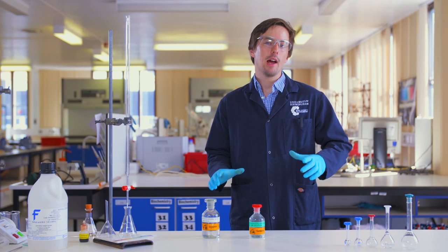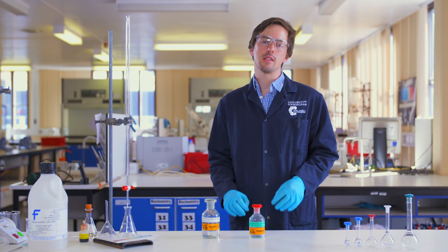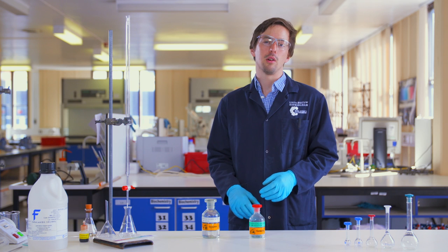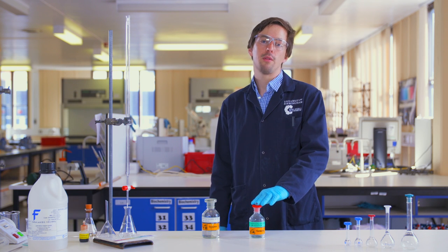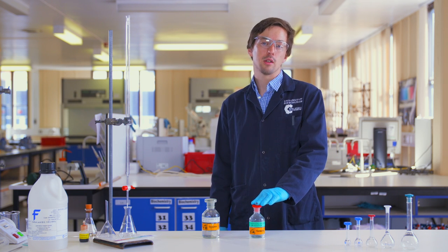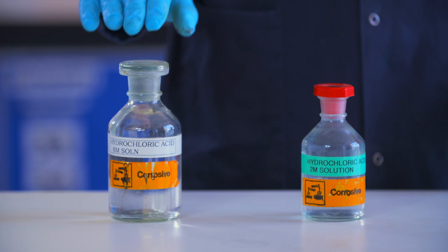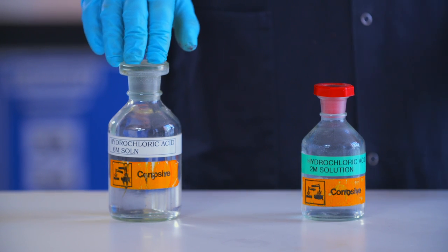So how do we determine the potency of an acid? Here in the lab we can look at the concentration of acids in solution, and that can tell us a lot. This two molar solution of hydrochloric acid is corrosive, but this six molar solution will cause a lot more damage if I spilled it.